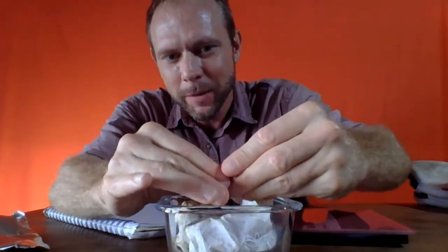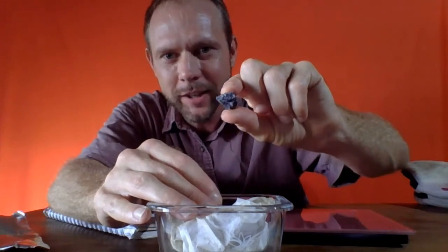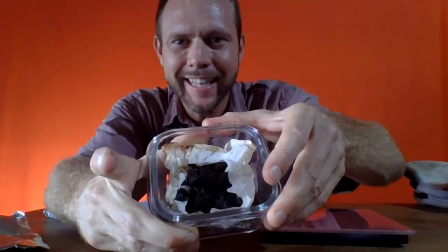And as I break a piece open, I can see there's a little bit of white material in there, and it looks like it is possible that there is still a little bit of salt mixed in with the sand. We didn't see it when it was wet before we put it in the oven. Perhaps the salt was dissolved, and now that it's dry, that salt has crystallized, and you can see it sort of stuck the sand into these relatively hard rocks.